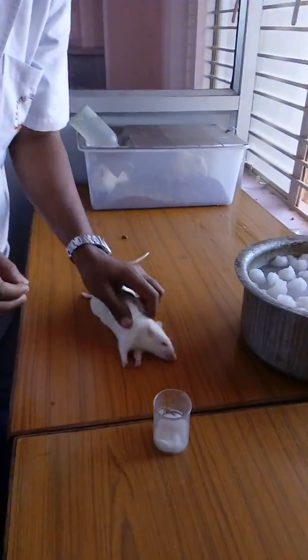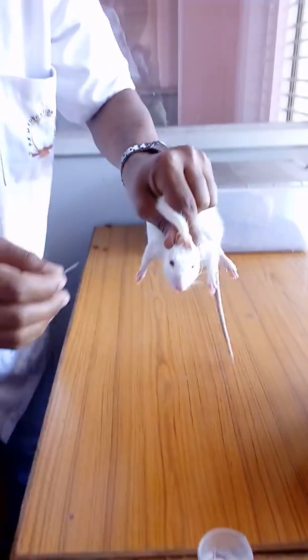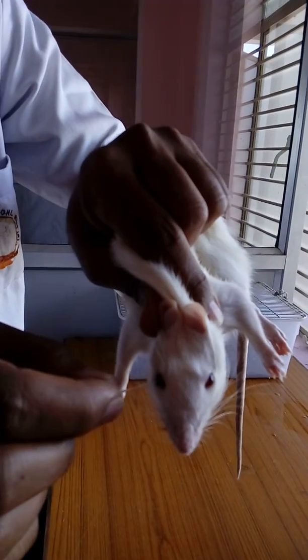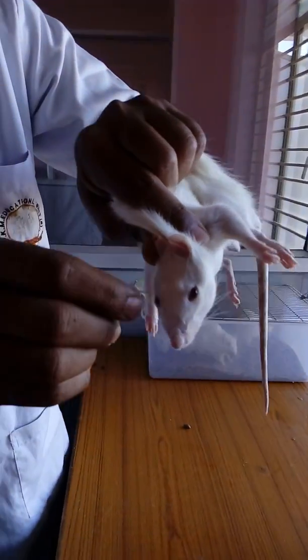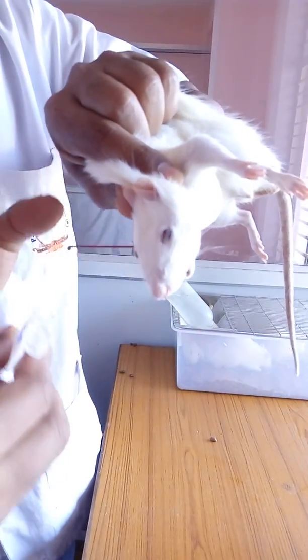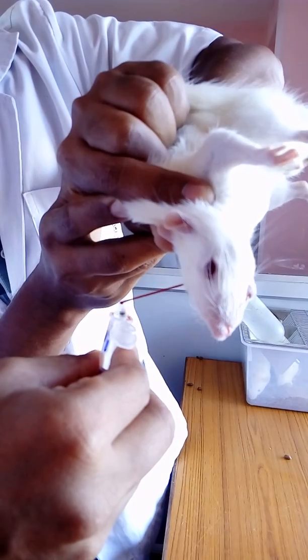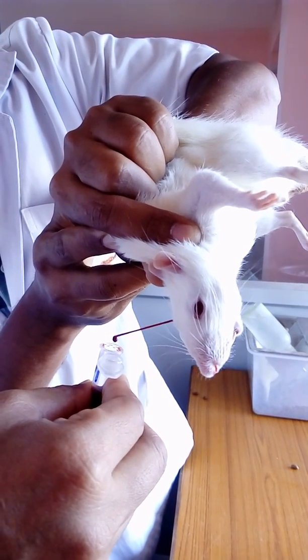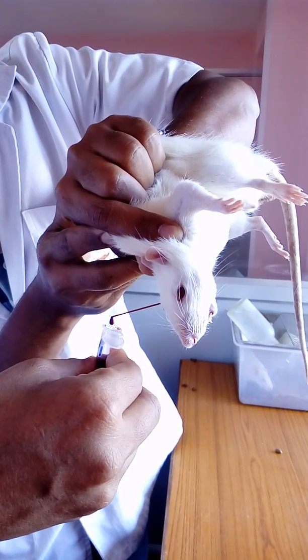From the nose side, we rotate to the ear side and focus on this area. The blood comes out through this route, allowing us to collect a larger amount. By cardiac puncture we have to kill the rat, but with the retroorbital method we do not need to kill the rat.